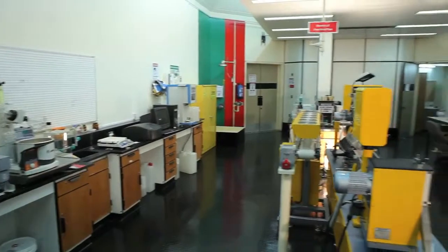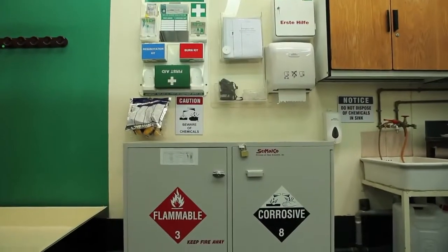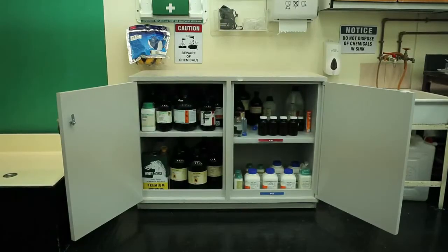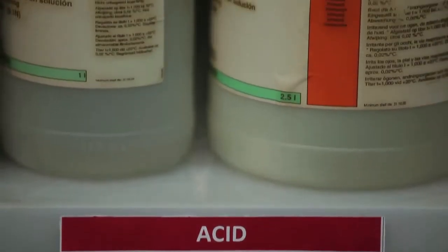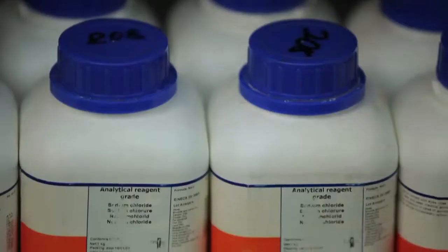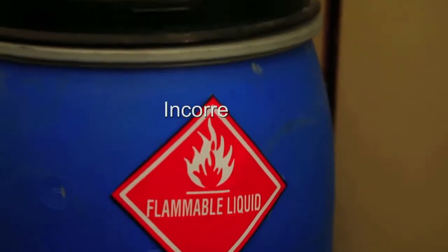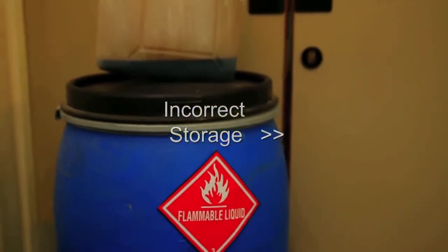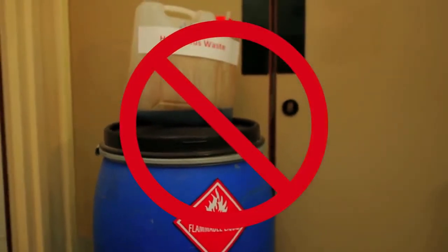Storage of chemicals and flammable or combustible liquids requires specific attention. Acids and corrosives must always be stored in an acid corrosive cabinet. Store acids in secondary containment, separate from bases. At any given time, no more than 10 gallons of flammable and/or combustible liquids may be kept outside the storage cabinets in laboratory areas.